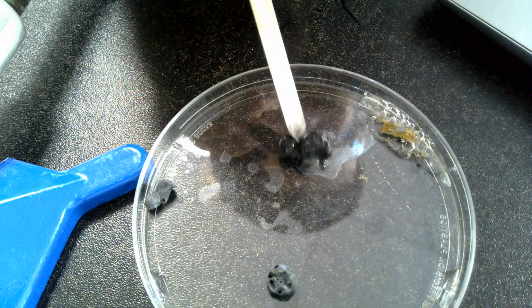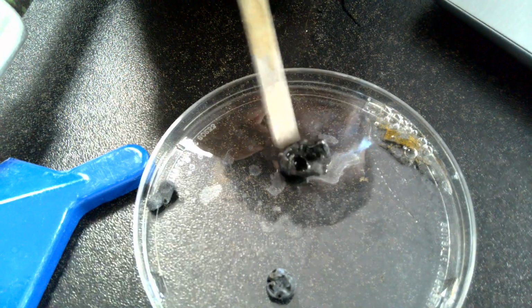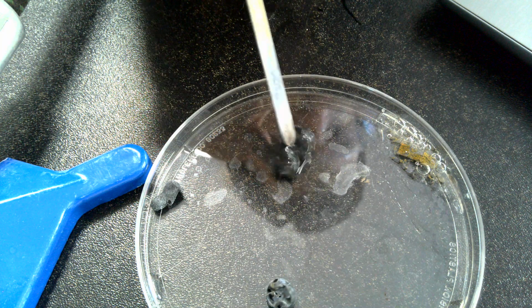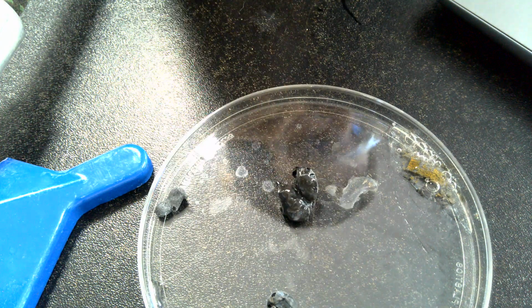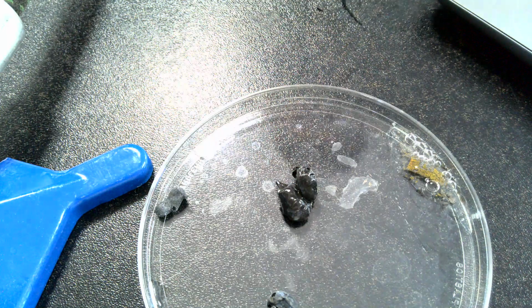It has gone kind of a black color. I would love to say the shininess is something, but that's just water. We've lost some of that dull gray color. It is now this black, gross color. It is still hard. You should be taking observations on this as well. So that is the zinc.